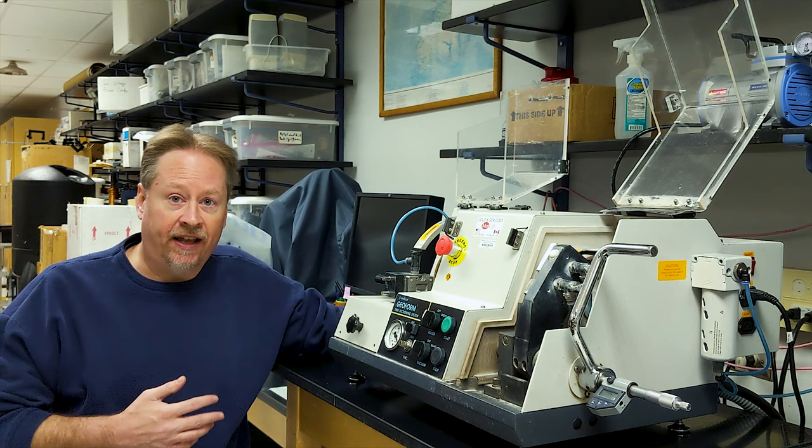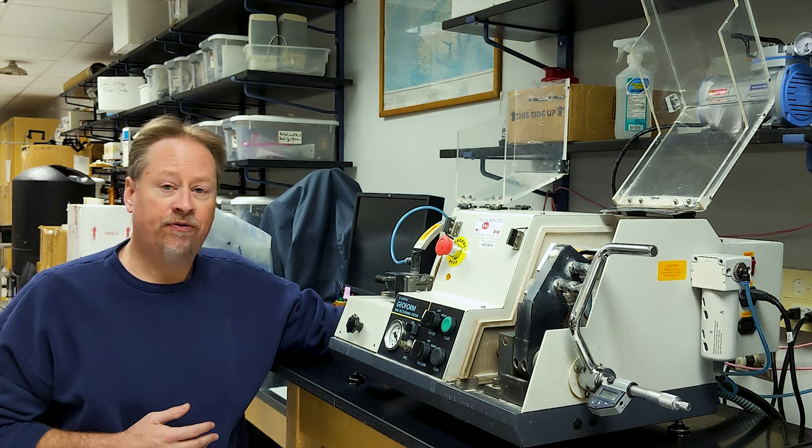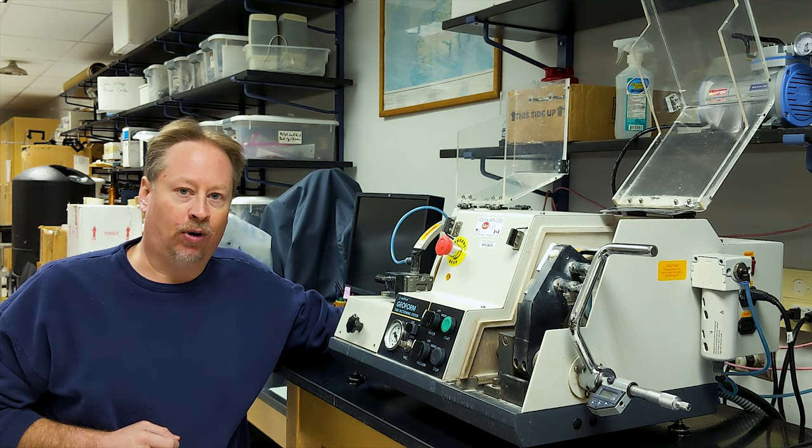Sarah's going to go ahead and get our samples ready to cut on the rock saw, so I'm going to show you our final piece of equipment that we'll be using in the thin section making process.